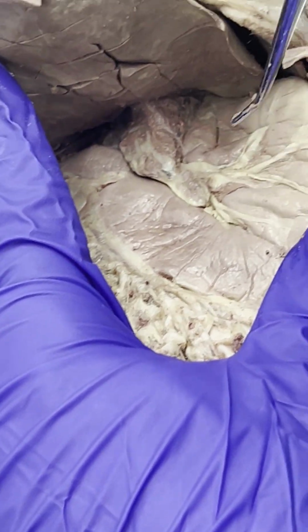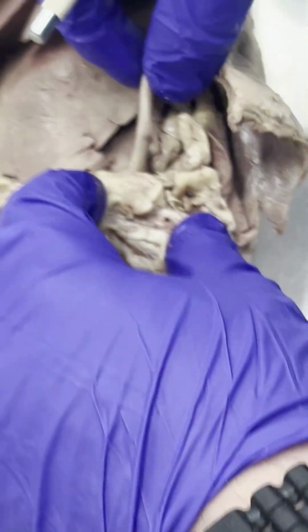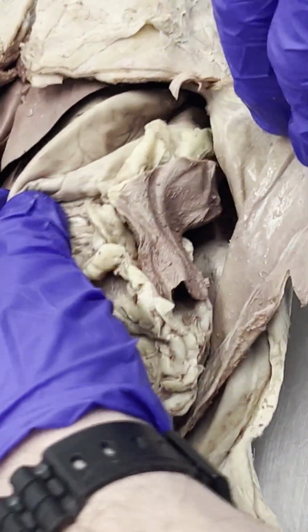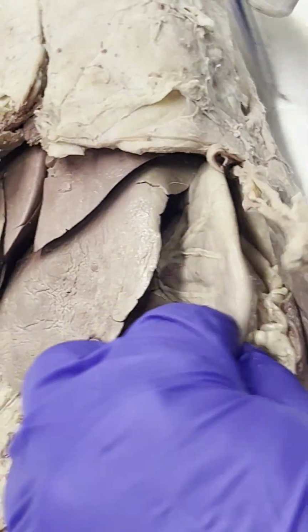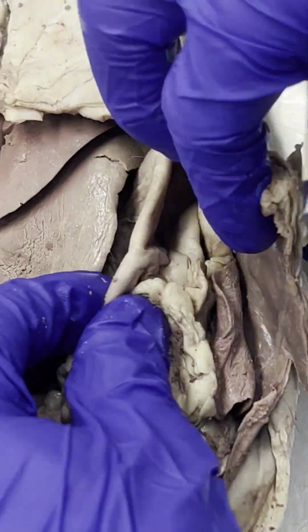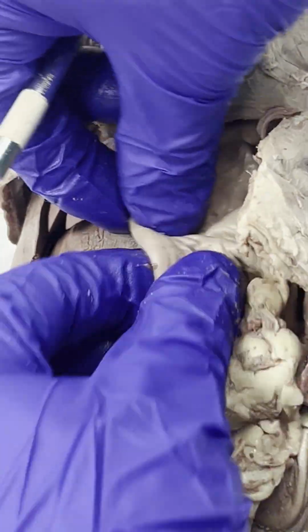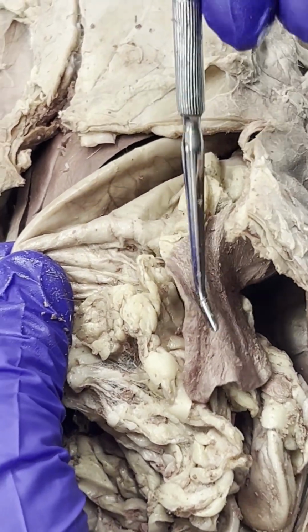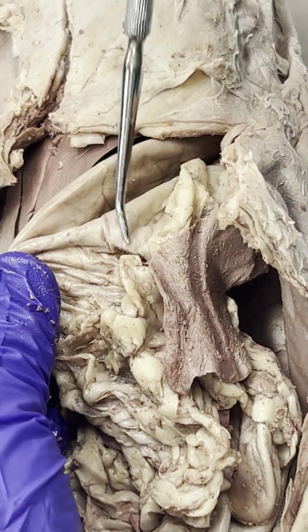Because we're talking about the stomach, and because we mentioned the spleen already, we have the gastrosplenic ligament. It's the only ligament that I think you need to know for the class. I say that hesitantly, but the gastrosplenic ligament is going to connect the stomach, which is right here, to the spleen, which is right here. So the gastrosplenic ligament is more or less going to be all this area right here, because here's our spleen, here's our stomach that I'm holding with my left hand right here.